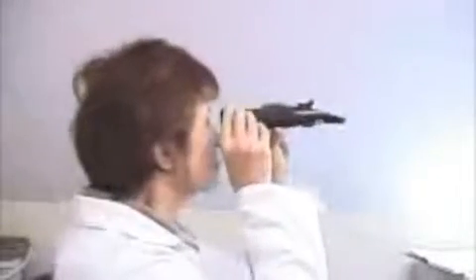A refractometer is an instrument used to measure the specific gravity of urine. To calibrate the instrument, a drop of distilled water is placed on the glass. The refractometer is held up to the light and the scale, visible inside, should show a reading of 1.